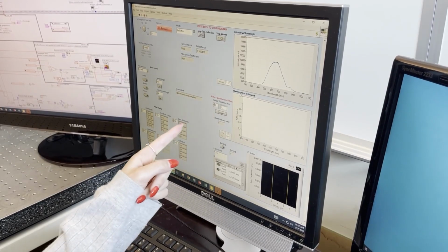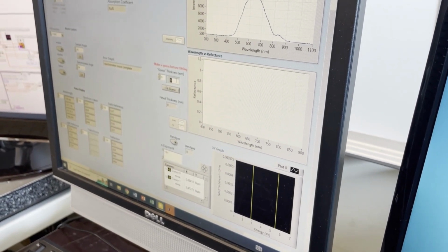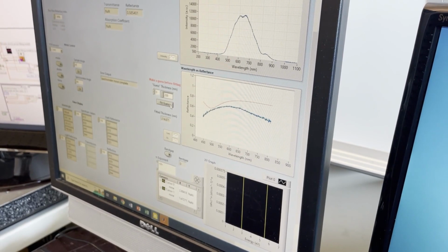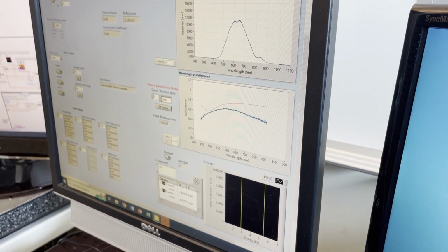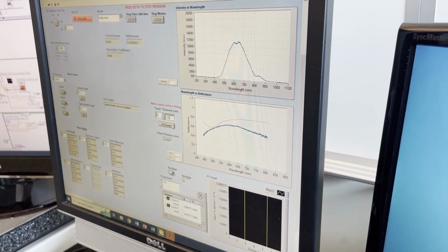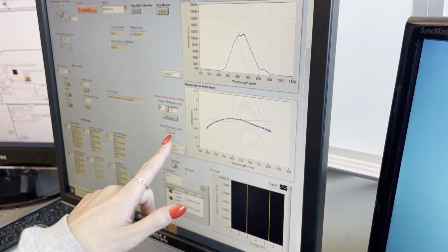Also make sure you fill in this box. This is a guess for the thickness. You can choose any reasonable guess and hit fit guess, and then afterwards you can change your guess, fit again until you see what you like. I'm going to try 200, then hit fit guess, and you'll see down here with this key, blue is the data for reflectance over this spectrum, and red is the fit. If you don't like the fit, you can decrease or increase until you see something better. The fitted thickness that is decided as the best fit in a range around the guess is displayed.